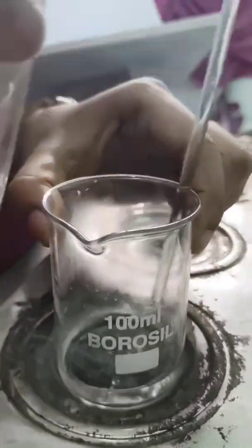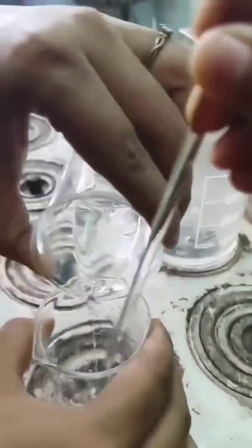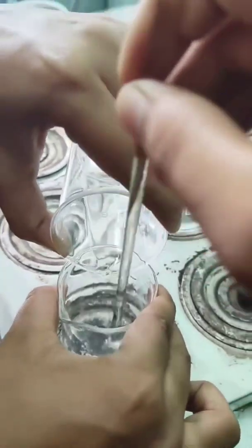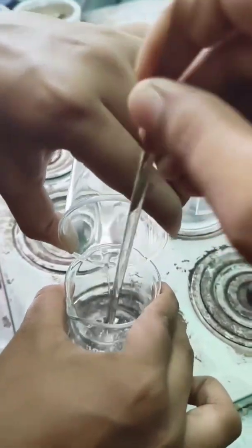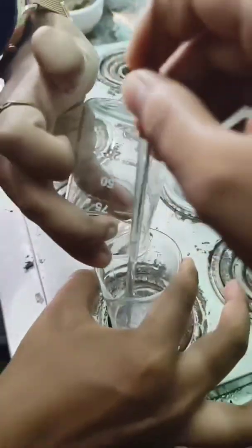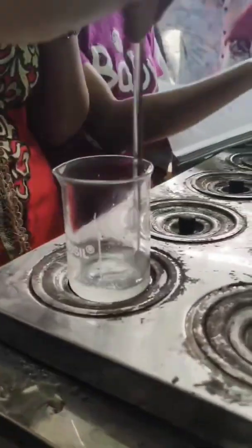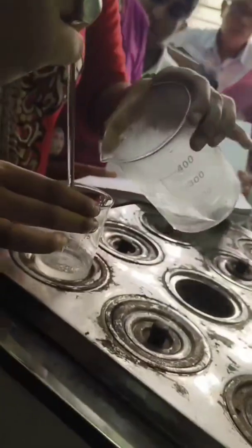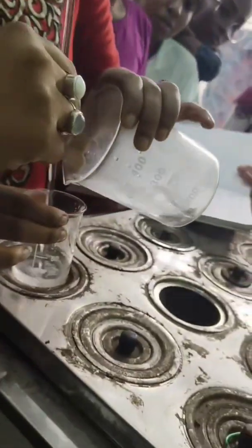Step 1. First, we prepare the oil phase by melting cetostearyl alcohol, white soft paraffin, and liquid paraffin together at about 70 to 75 degrees centigrade.